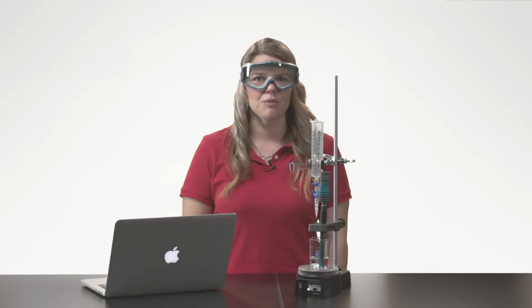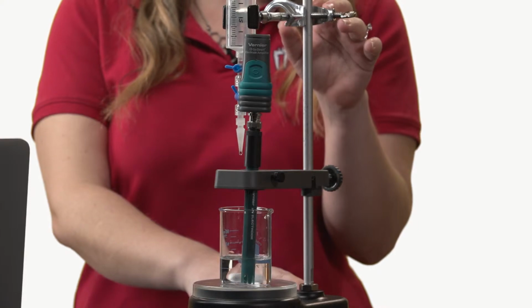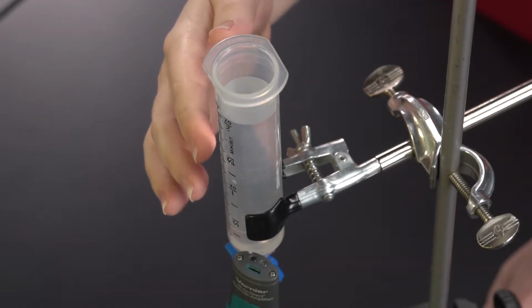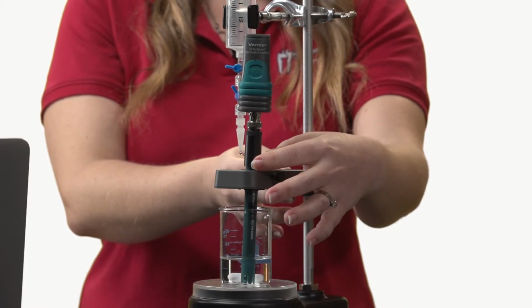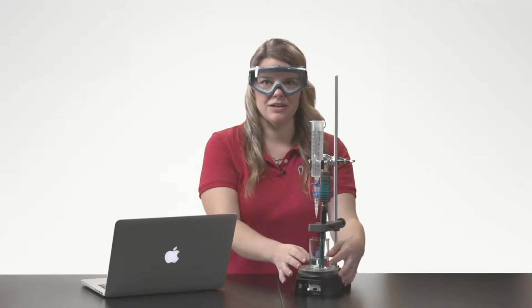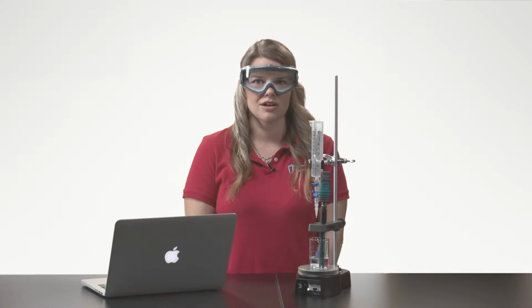To get started, I want to make sure I have assembled my titration apparatus. I have my stir station with the utility clamp holding my reagent reservoir for the drop counter. Sodium hydroxide is in the reagent reservoir. The drop counter is attached. The pH probe is in the electrode opening, and the drops from the reagent reservoir go through this opening. In the beaker, I have a magnetic stirring bar, 10 milliliters of hydrochloric acid, and 30 milliliters of distilled water with a few drops of phenolphthalein indicator.